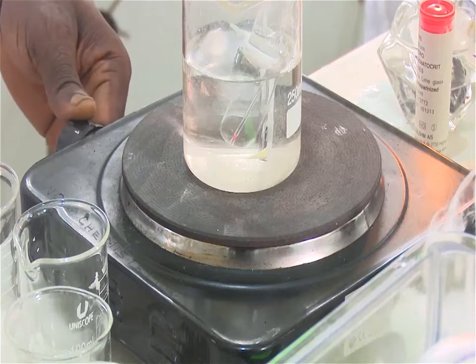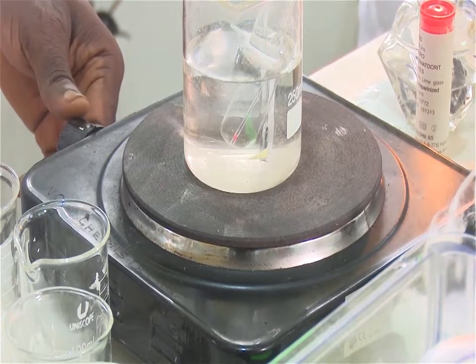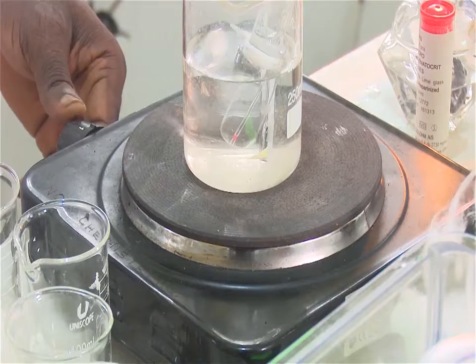As the temperature decreases, the bubbles will slow down, and at some point, the liquid will rise into the capillary. The boiling point of the sample is reached when the bubble stops. Then read the thermometer and record the temperature.